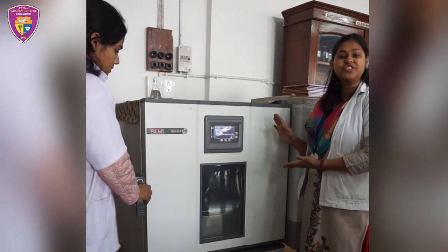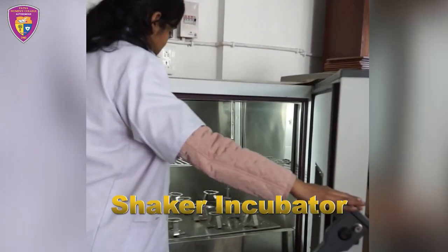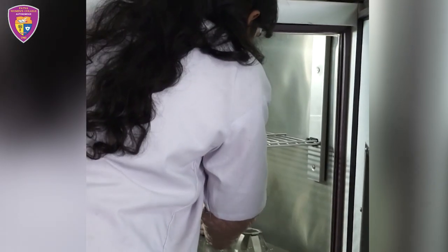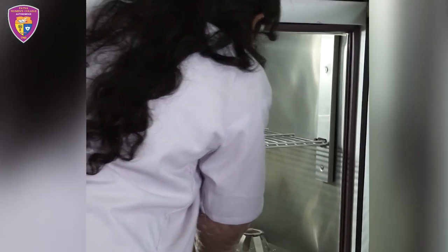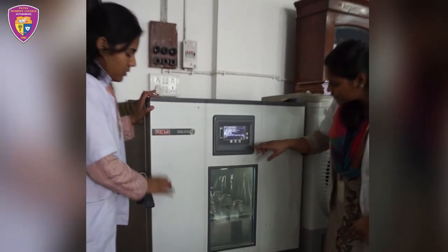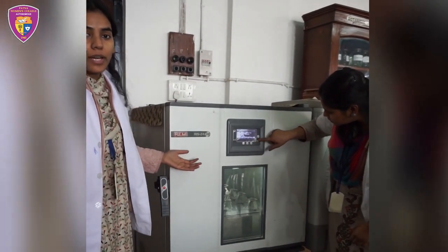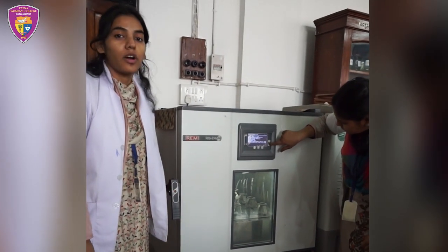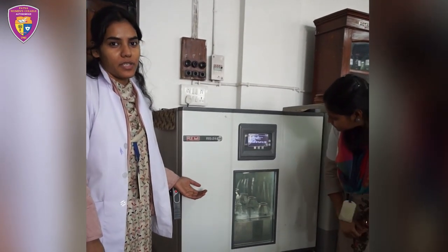This is a shaker incubator. The shaker incubator is a thermostatically controlled apparatus which is used to cultivate microorganisms in a broth medium. It works by providing even distribution throughout the sample and also provides consistent temperature to the sample.